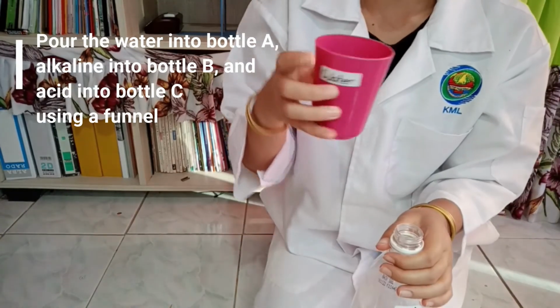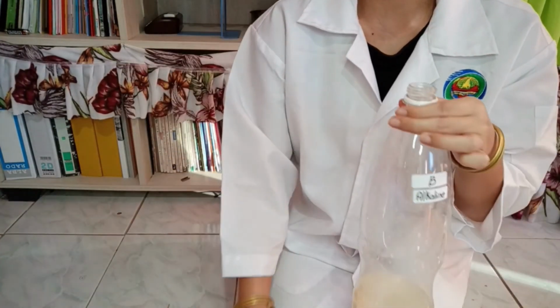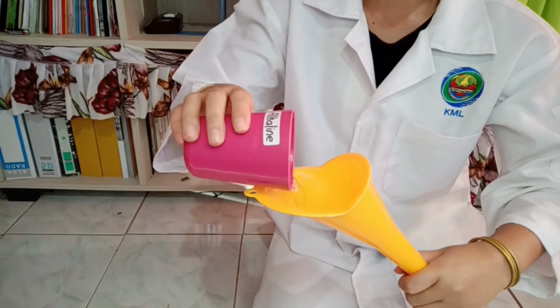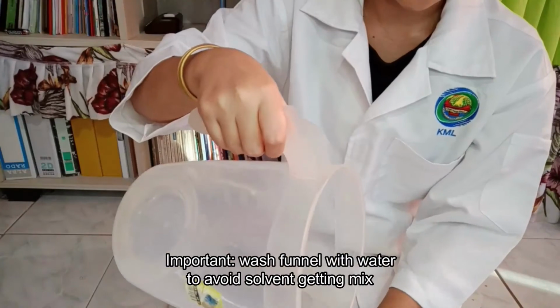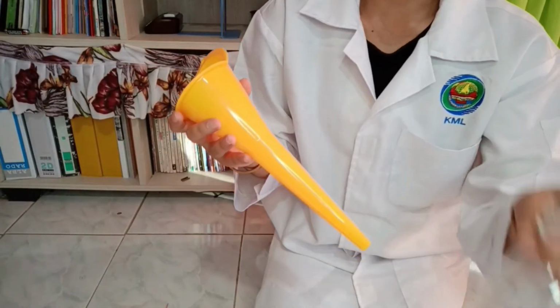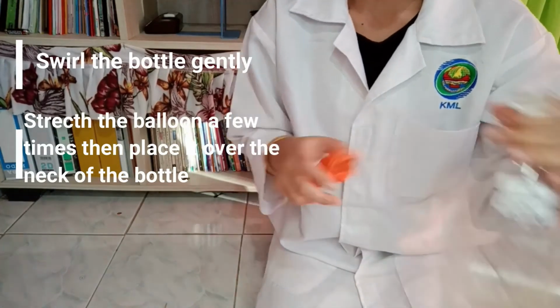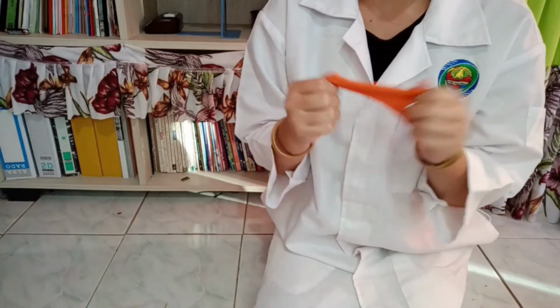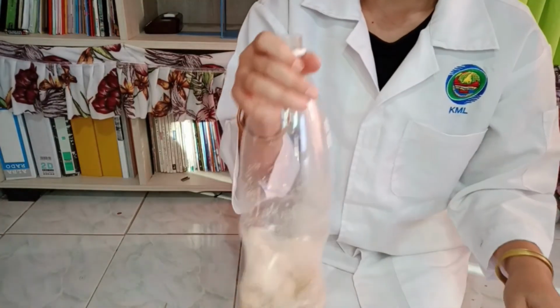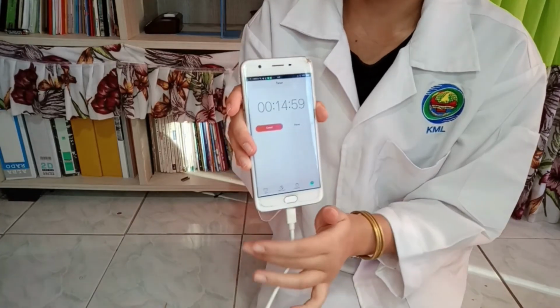Next, pour the water into bottle A, alkaline into bottle B, and acid into bottle C using a funnel. Next, swirl the bottle gently to mix up evenly and stretch the balloon a few times and then place it over the neck of the bottle.